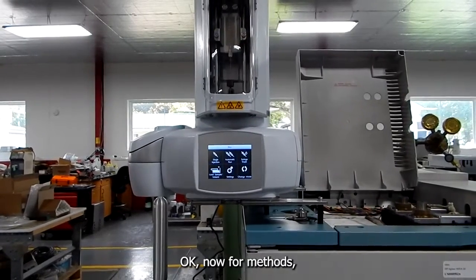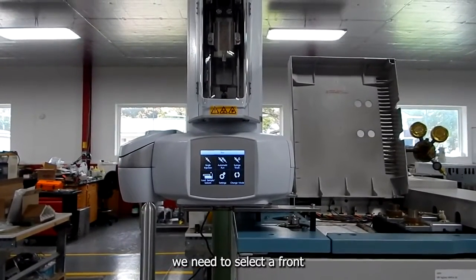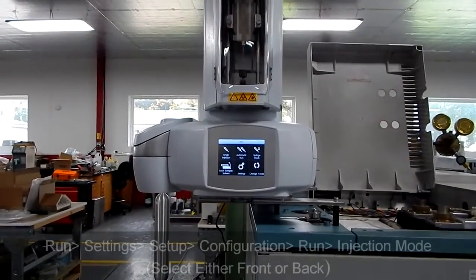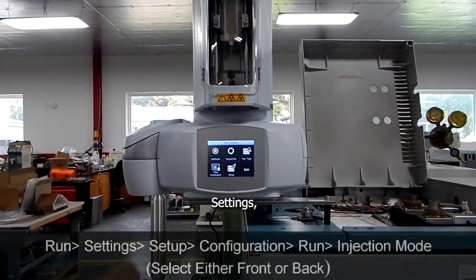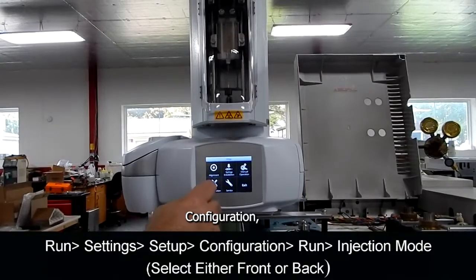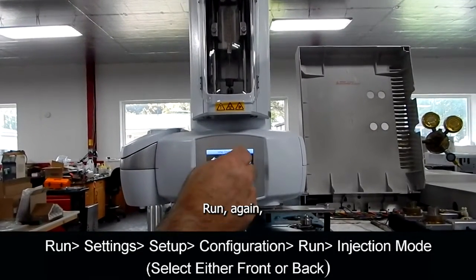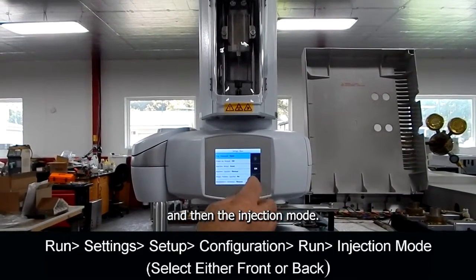Okay, now for methods, we need to select a front or back injection port for our particular method. So again, we're going to start from the run screen and go to settings, setup, configuration, run again, and then the injection mode.